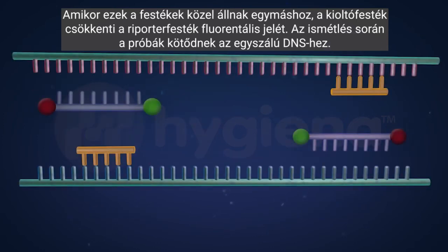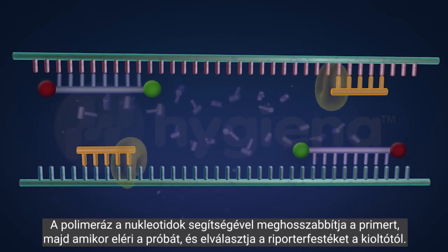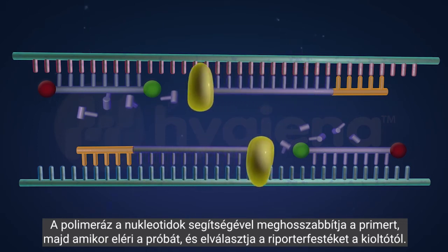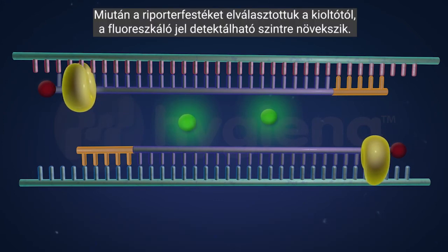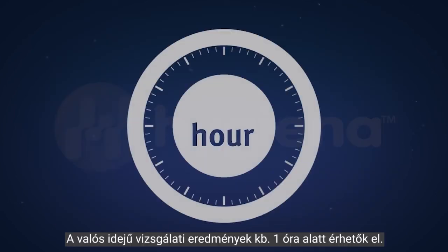During replication, the real-time probes bind to the single-stranded DNA. The polymerase uses the nucleotides to extend the primer, which reaches the probe and cleaves the reporter dye from the quencher. Once the reporter dye is separated from the quencher, the fluorescent signal increases to detectable levels. The BAX system then uses dye-specific filters to measure this signal at the end of each cycle and report positive or negative results for each target in the assay. Real-time assay results are available in about 1 hour.